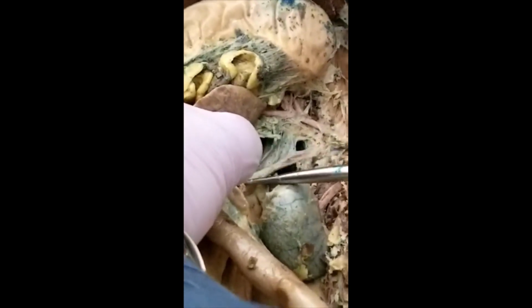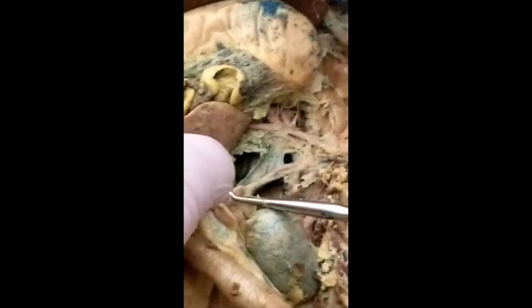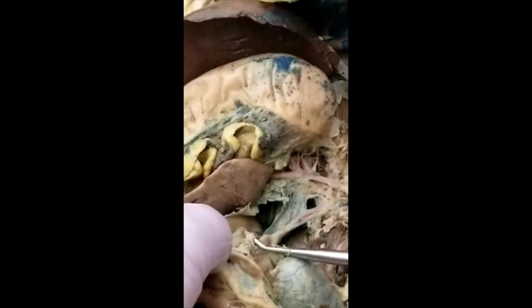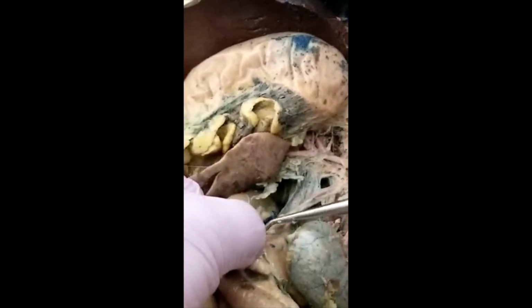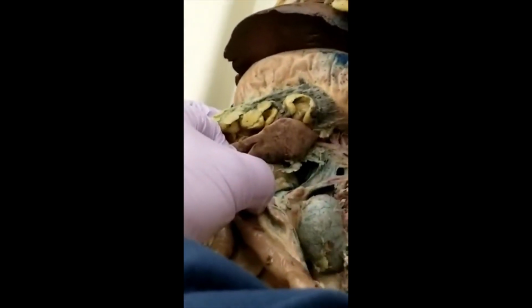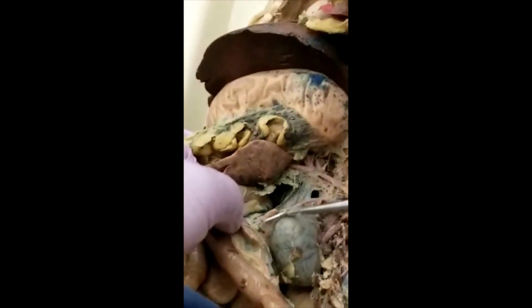Superior mesenteric, you can see this one, the first branch, supplying the colon. So that's the colic. Well, we call it the superior colic. And if you dig a little bit more, you can see it's going down through here. See that? So that's the colic.